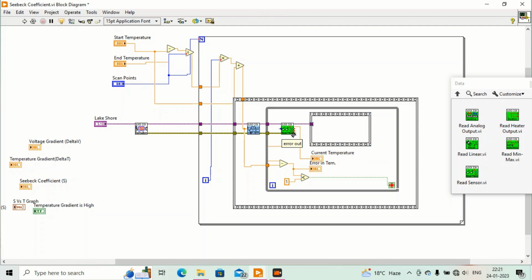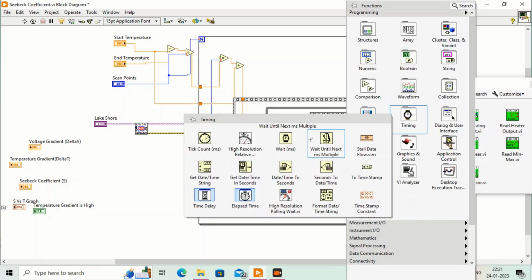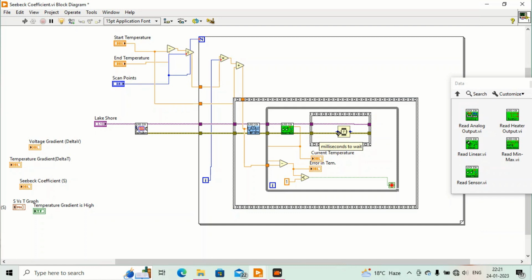We'll connect here and connect here, and we will wait for some time. I will put 1000 millisecond. So whenever this temperature is greater than 1 Kelvin or 1 degree centigrade, this will wait for 1000 and we'll check it again.